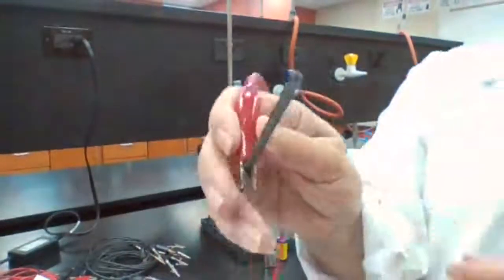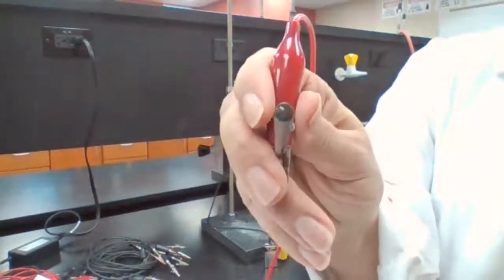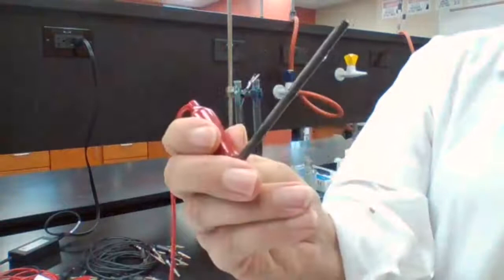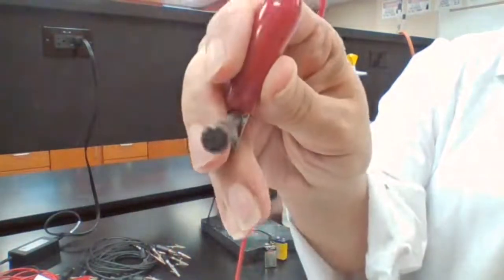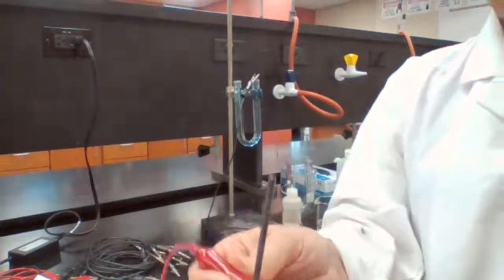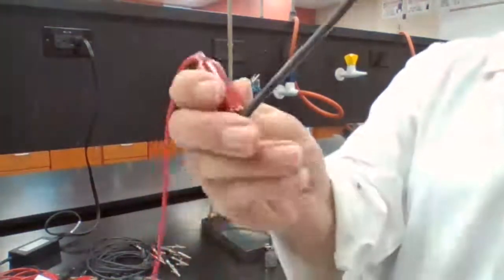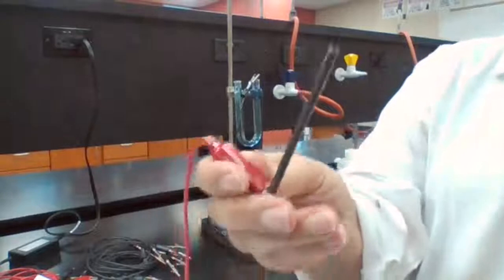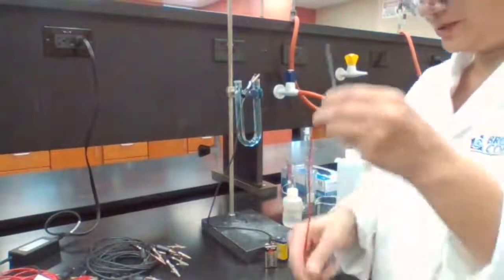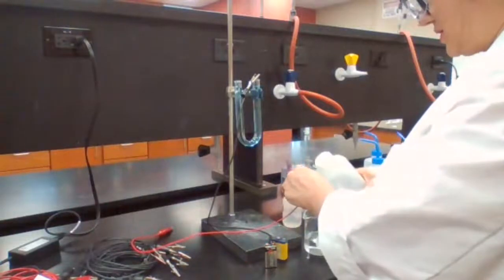Okay. The tip, the end of this graphite, it has red dots. And what does the red dot mean? It means copper has been reduced. So Cu2+ has changed to Cu solid because we have those dots there. And as a result, copper has been reduced. If copper has been reduced, of course, water is not reduced. So I don't expect to see the phenolphthalein color change.